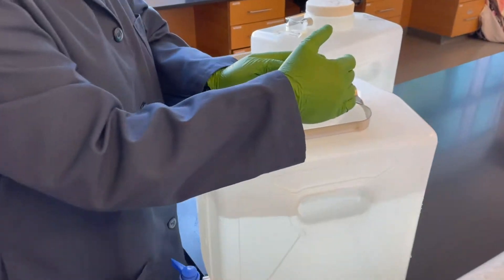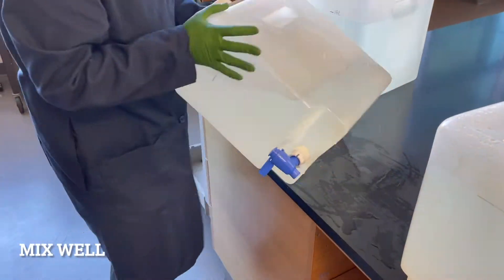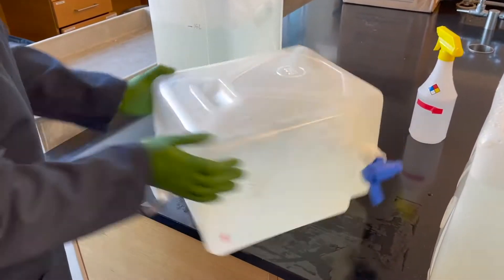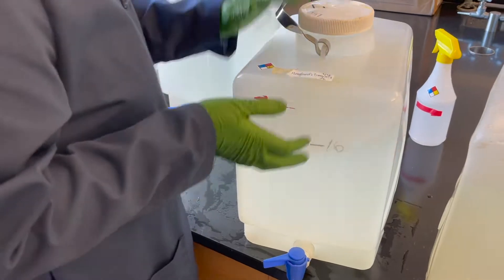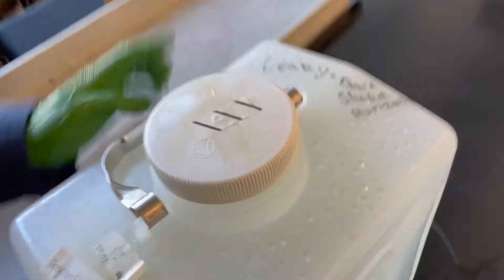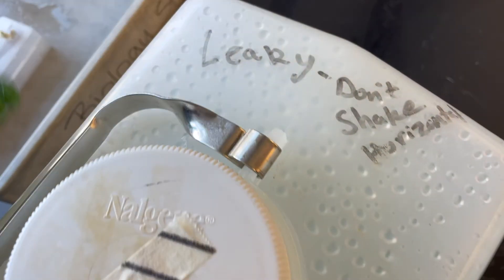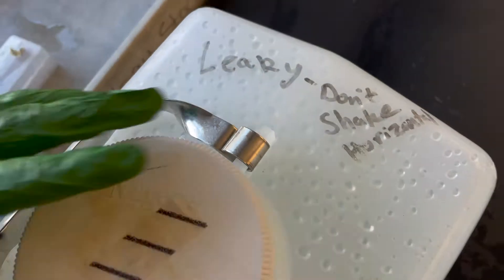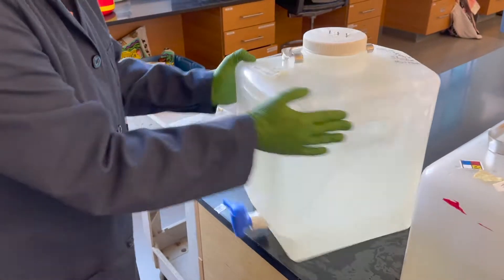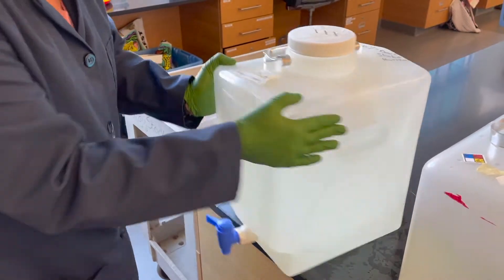Now close tightly and mix very well. The best way to mix is on the side, if you can. If you cannot tilt the container, do your best to mix it standing up. Take your time.